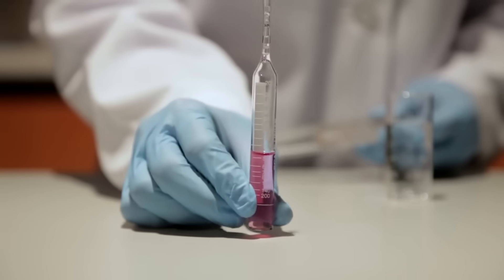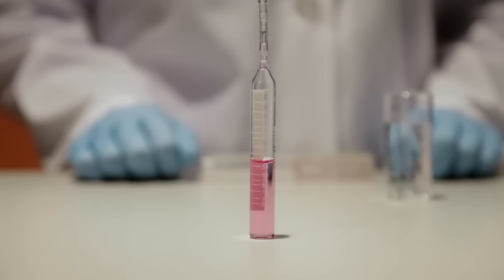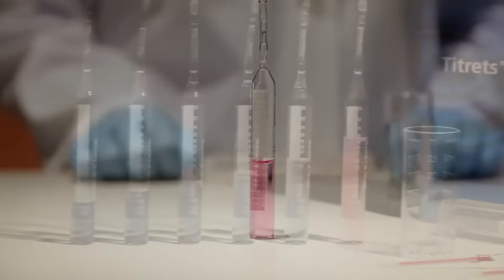Hold the ampoule in a vertical position and read the scale opposite the liquid level. Results are expressed in ppm, milligrams per liter, as calcium carbonate.